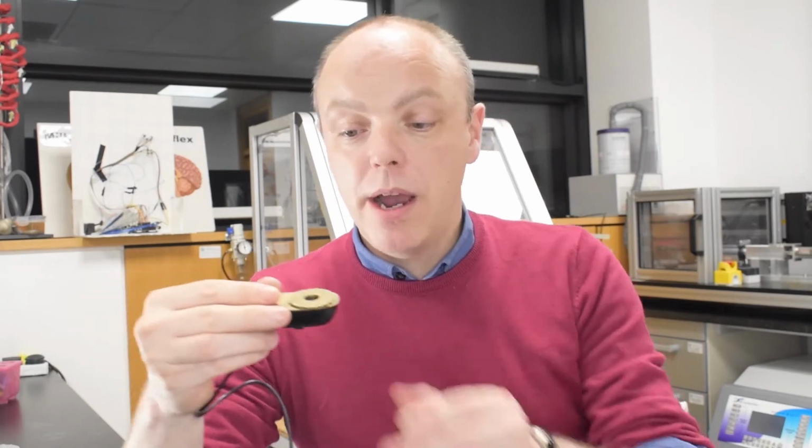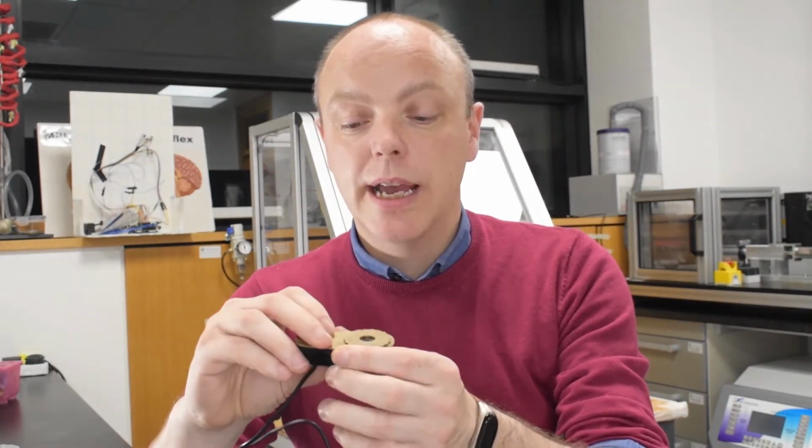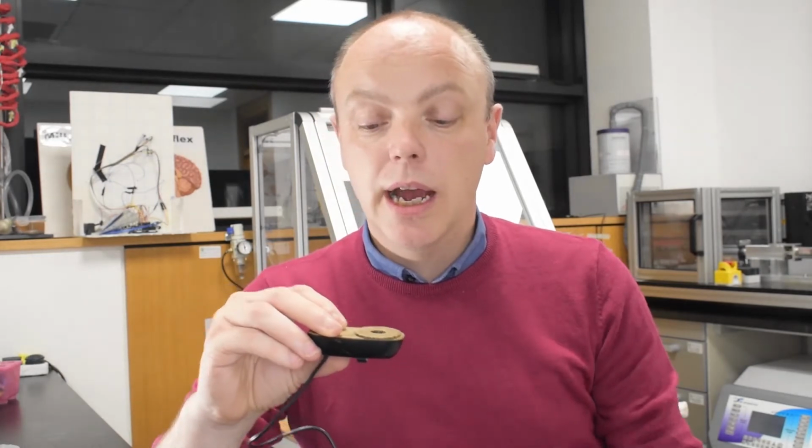We have a favorite webcam that we use for this, and this is a Logitech C270. It's relatively cheap. You can find it from lots of different places. You can buy it online. It's not the most powerful webcam in the world. It's not the highest resolution or the best quality or anything like that. But what it is, is one of the easiest to modify and hack and turn into, in our case, a microscope.